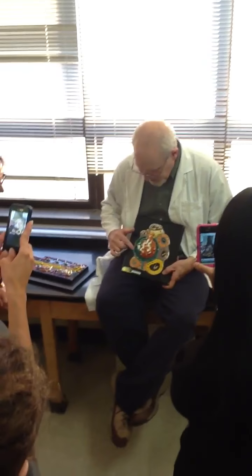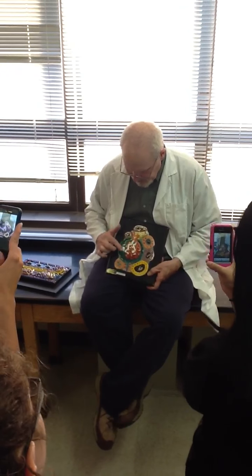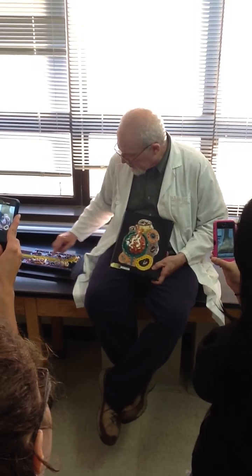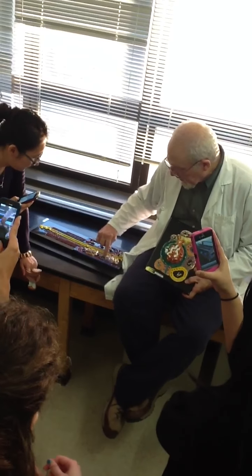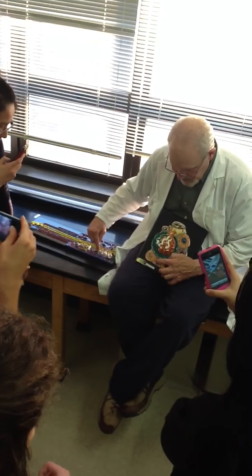Capsule. This is the parietal layer, it doubles over, and of course this is the visceral layer with the podocytes. This is just glomerulus. This, of course, is the beginning of the proximal convoluted tubule. Here, that is going to be brown. So here we see the corpuscle, and there's a little brown thing coming out. Here it's salmon colored. That's fine.